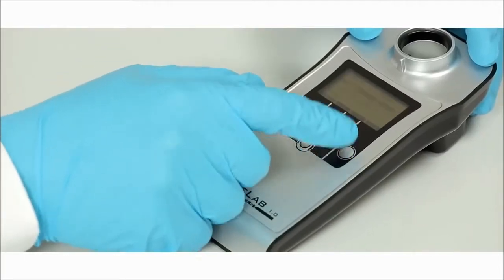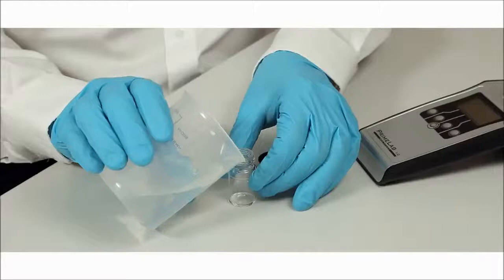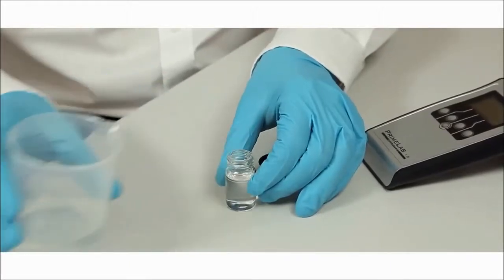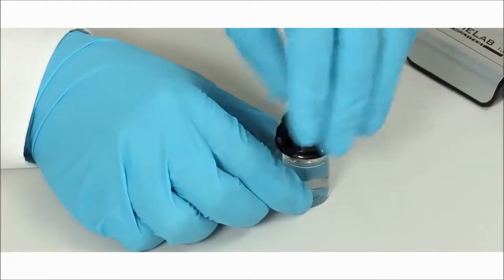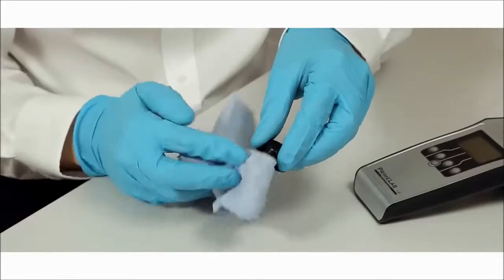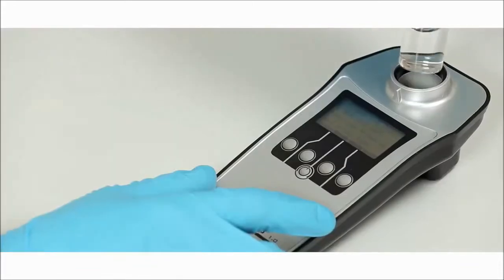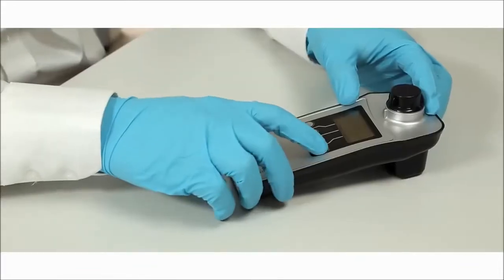First you will require a zero. Add 10 milliliters of your system water to a PrimeLab cell and close the lid. Wipe the vial clean and place in the PrimeLab. Press zero.